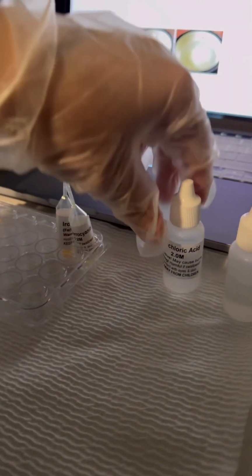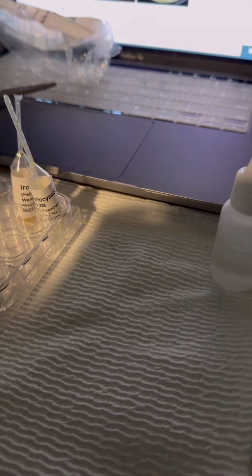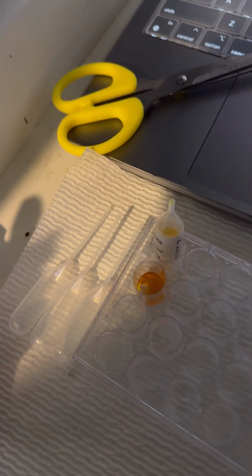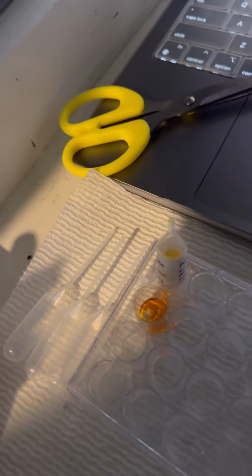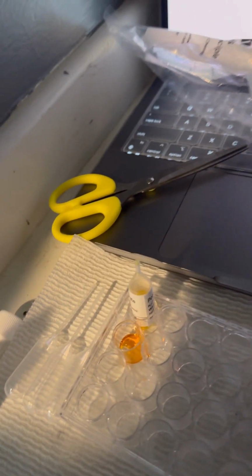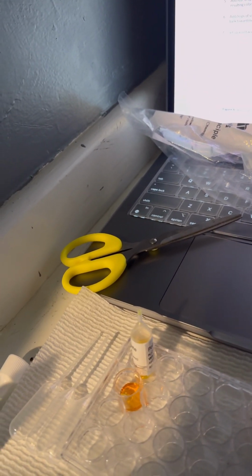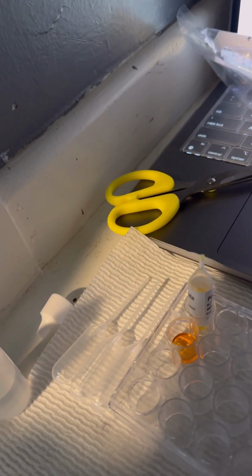So let's do 4 drops of just hydrochloric acid. Alright. The color has turned from a bright yellow to a bright orange. So I will put this into the data table, and then it says to add drops of sodium hydroxide to the chemical system until the color change is complete, which should bring the mixture back to the reactants.